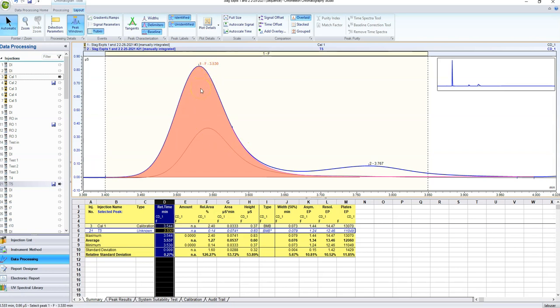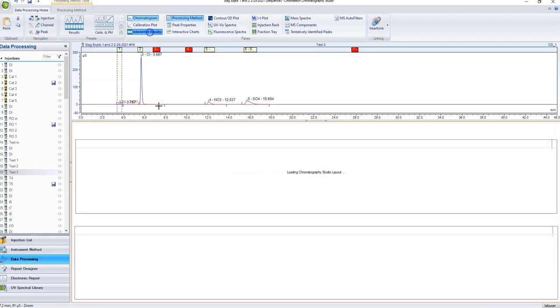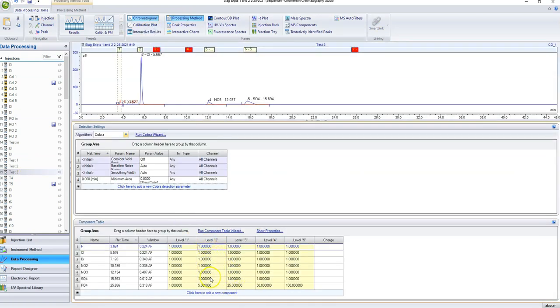You should always do this if you're ever worried that something is not the same chemical as was in your calibration standard. So all you really need to do is put all of the values in for your calibration points. So like if I wanted all of this data, I would need to fill all of this out before I take all my data off, copy and paste it into Excel, and if you ever get stuck, just ask someone who's familiar with the IC to help you.